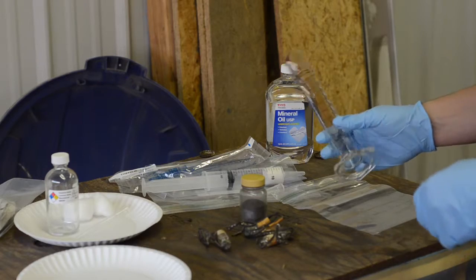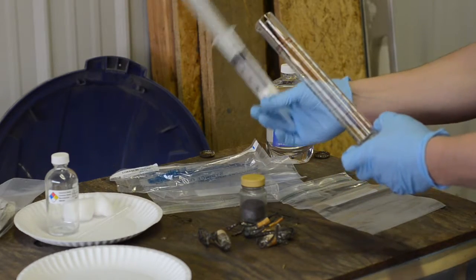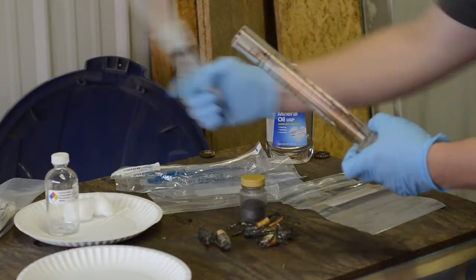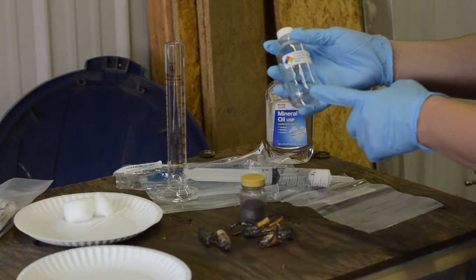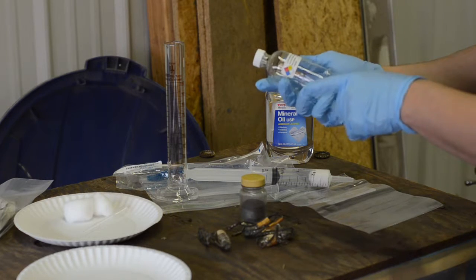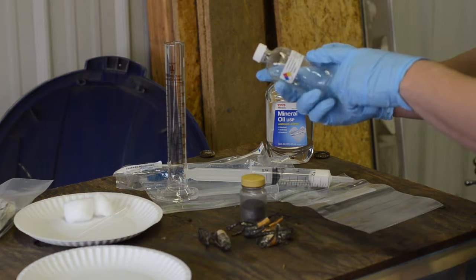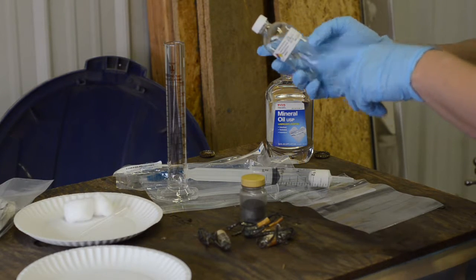Okay, so I've got a graduated cylinder that I'm going to use to place the first pass of filtration, and then we'll refill from this here, and it'll go into my bottle. Now, the bottle is a borosilicate glass with a PTFE-lined cap. That's what my reading indicated would be the best option here. I've already put a label on it, complete with a hazard diamond, and all the relevant information.